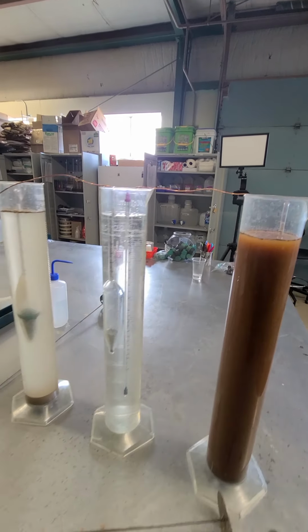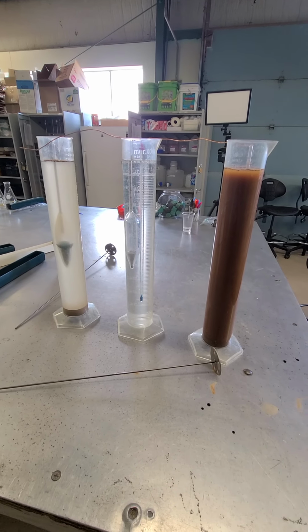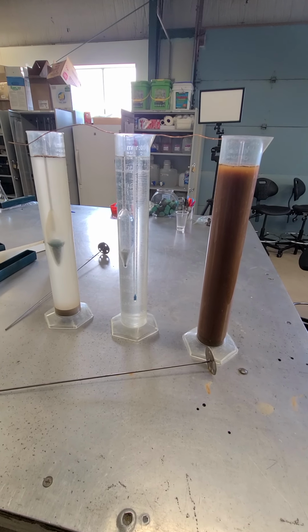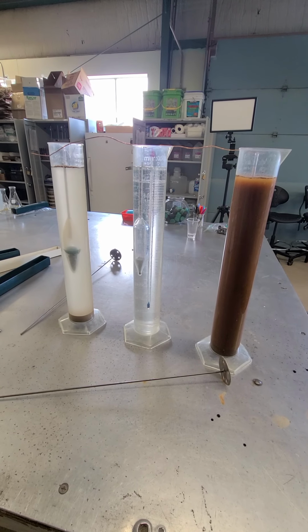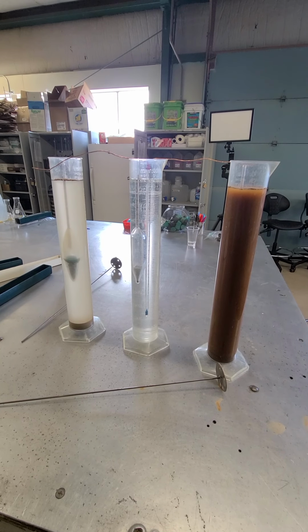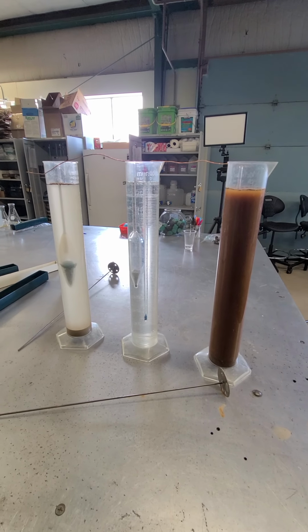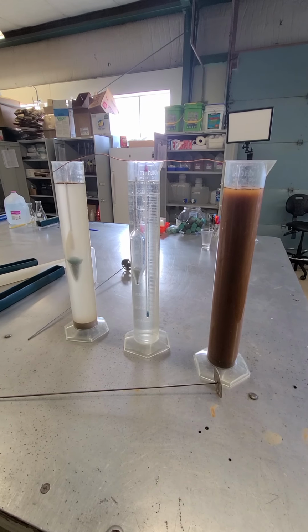Obviously lots of different samples are going to come up with lots of different readings, and the purpose of this video was just to kind of show you exactly what the procedure is and to kind of give you a visual of what it looks like with different textures, different particle types of soil samples. So to do this exercise, obviously we have to do it for you, but we'll go ahead and post some data sets, and you'll have an idea now how this all works. And with the data sets and the information and the equation that I give you, you'll be able to figure out what the texture of different soils is.